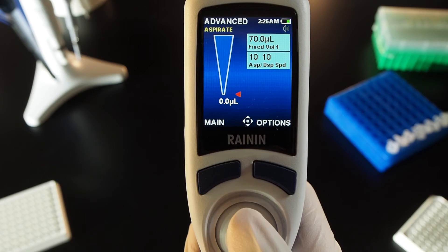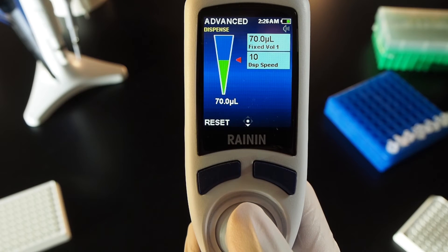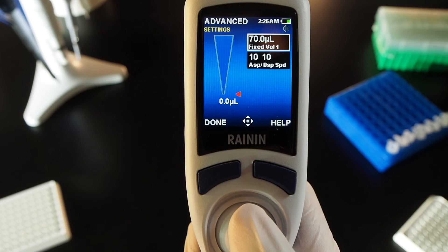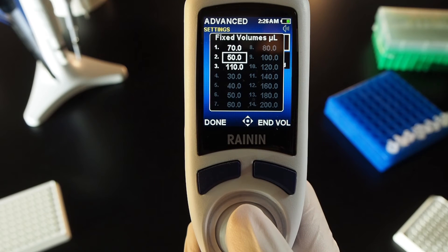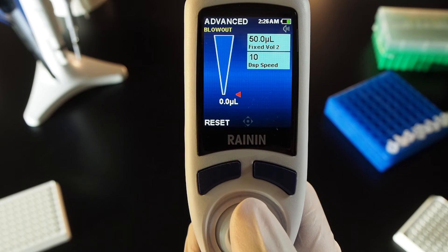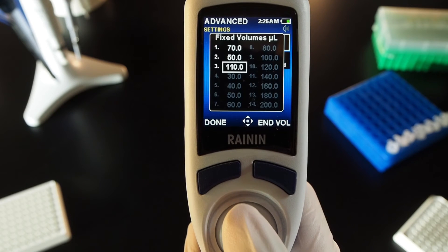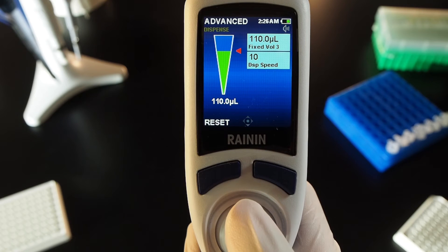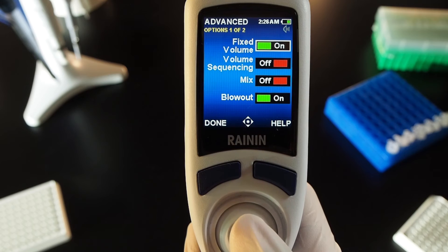You can adjust cycle speeds or joystick left to exit settings and run the first volume. Joystick up to aspirate and down to dispense. When complete, joystick right. With the fixed volume 1 box lit, press the joystick in. Joystick to your next volume and press done to exit. Press done again, joystick up to aspirate and down to dispense. When complete, joystick right. Press the joystick in, joystick to your next volume and press done to exit. Joystick left, up to aspirate and down to dispense. Press options and press the joystick in to turn off fixed volume.